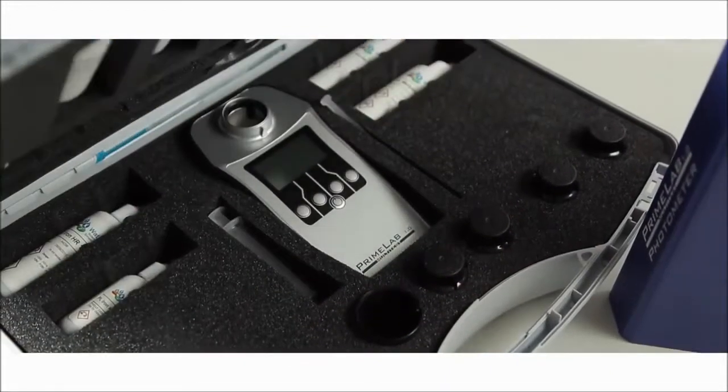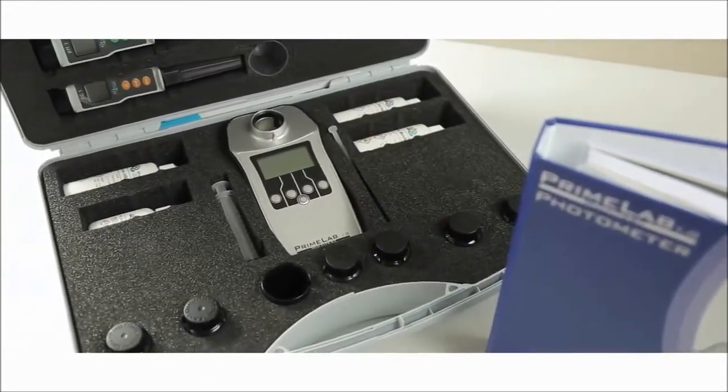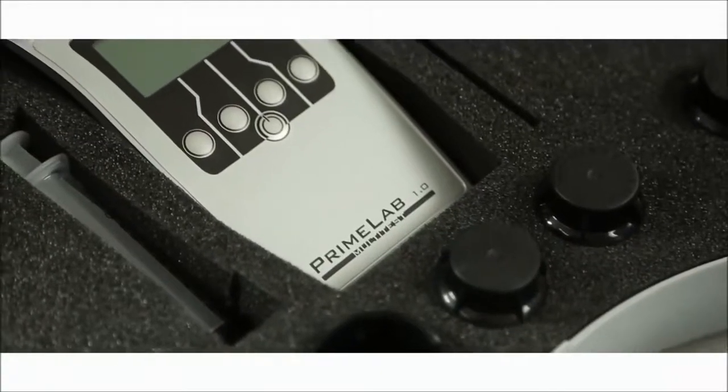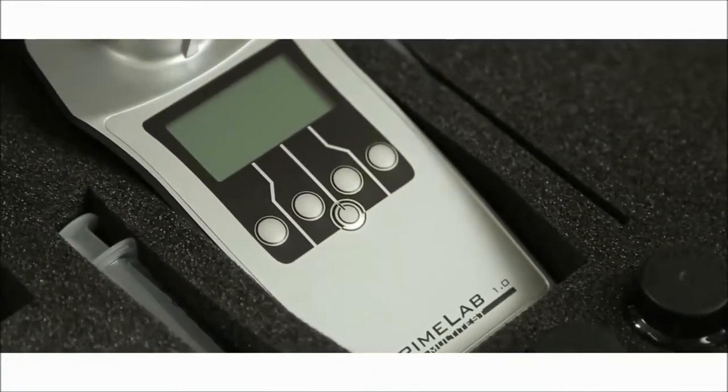Example test on a PrimeLab. Here we will demonstrate how easy the PrimeLab is to use using a standard molybdate test as an example.